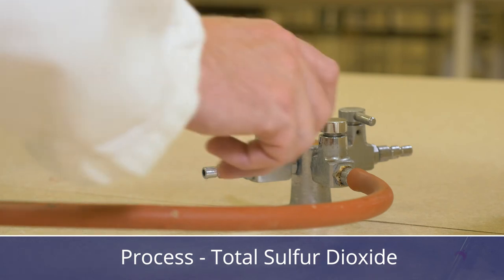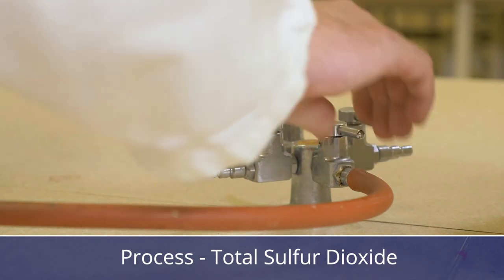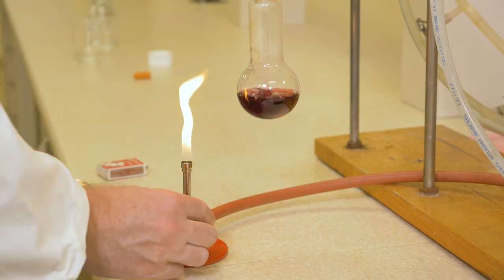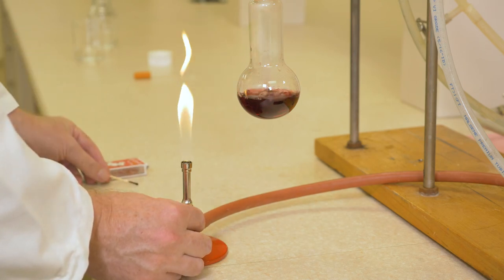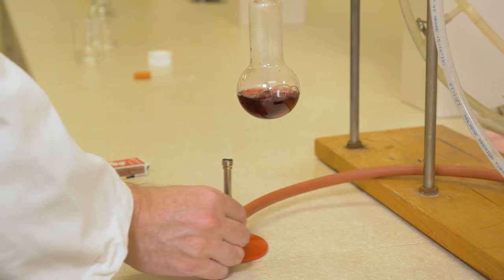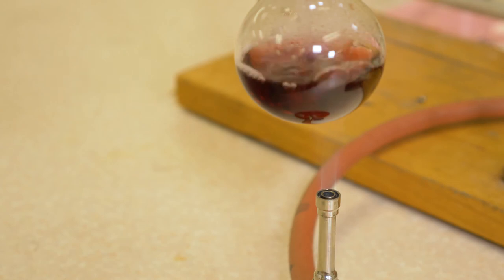To determine the total sulfur dioxide, the procedure is repeated on a fresh sample with heating using a small Bunsen burner or a heating mantle. It is important to note that the aim is not to boil the sample in this procedure but rather to heat it just short of boiling.